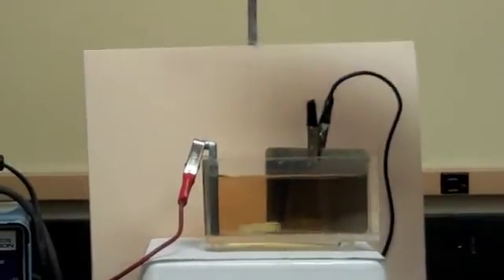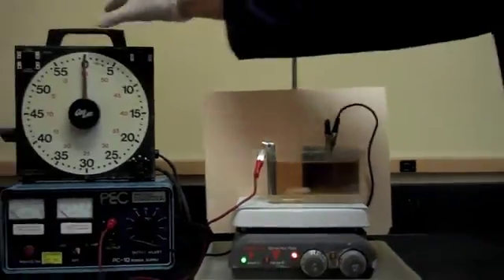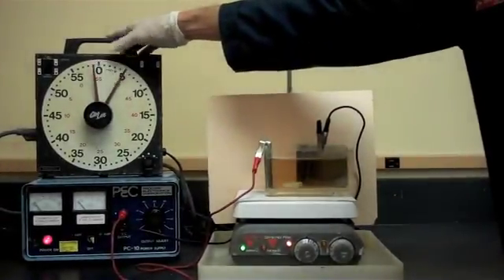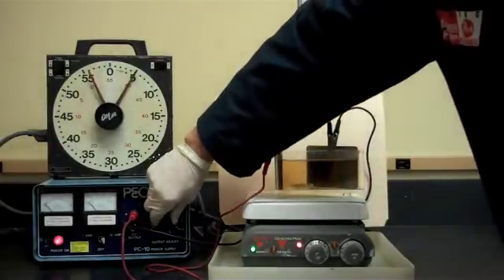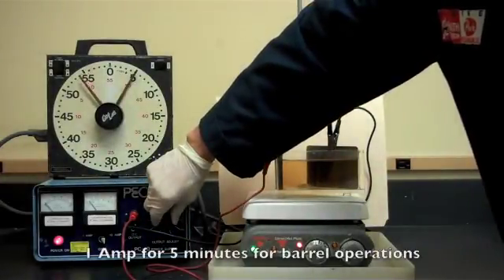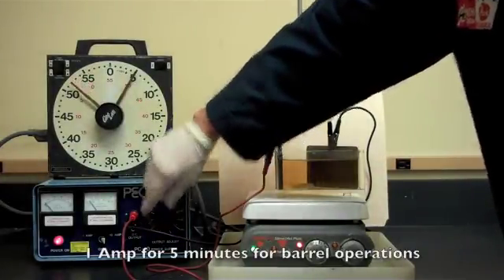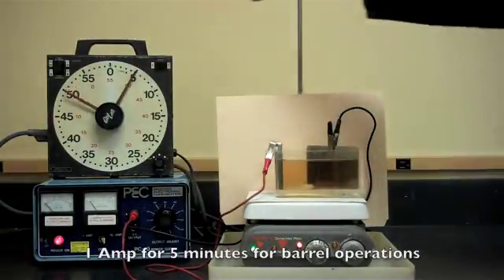Okay, and now we are going to turn the power on and we are going to set our power at one amp for a time of five minutes.